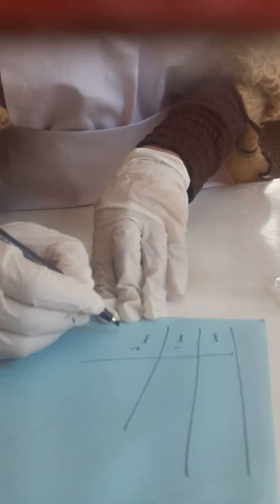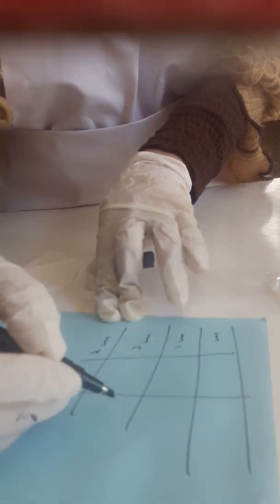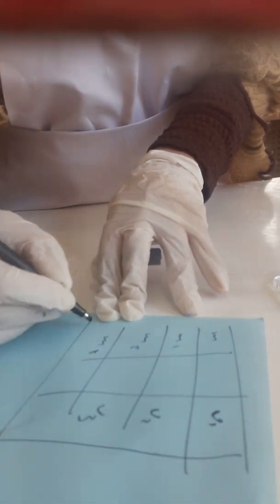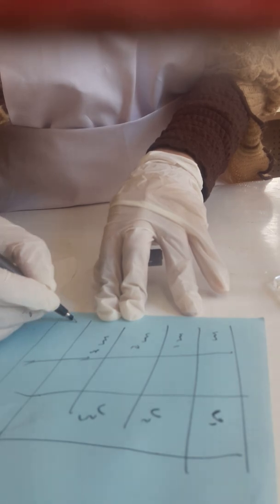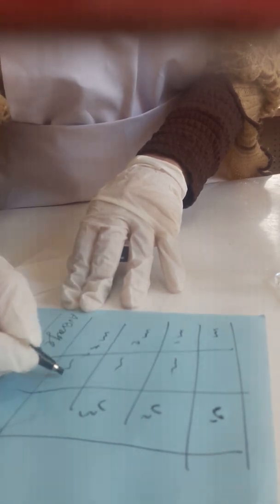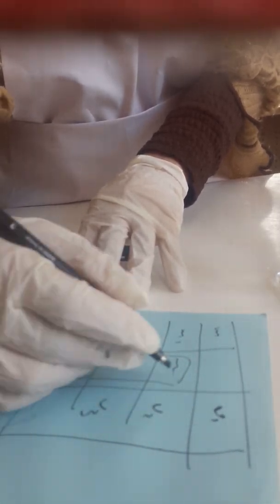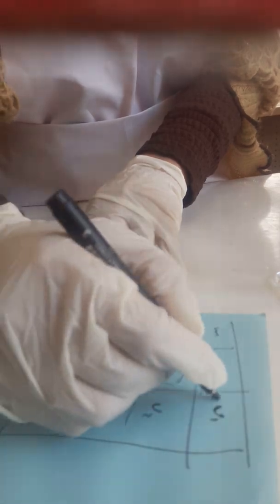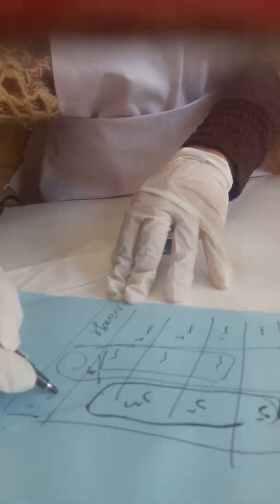The first volume, you have a table, the next table for V2. In your procedure table you have the mass M1, M2, M3. You have 3 trials for mass and then V1, V2, V3. Here you have the average. You have M1, M2, M3. You add the 3 trials, then divide by 3 to get the average mass. And then the 3 trials for volume that we will do together now, and then get the average volume.